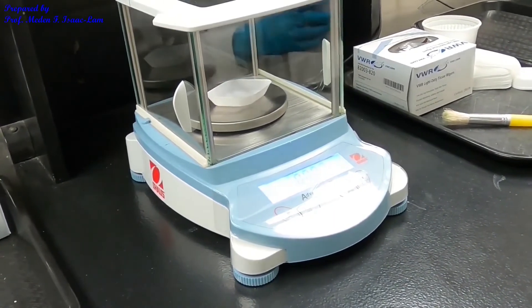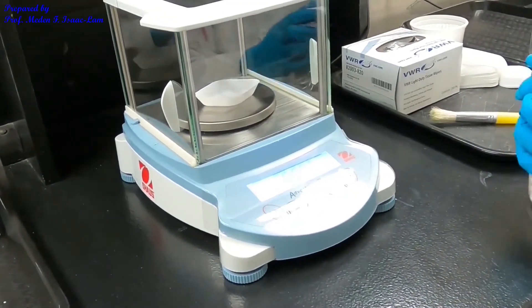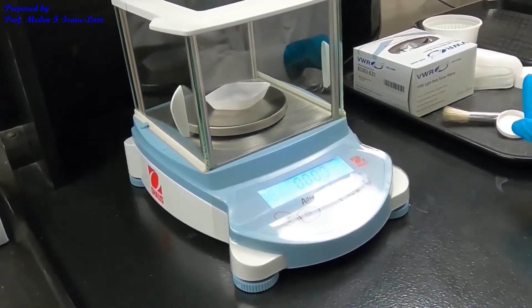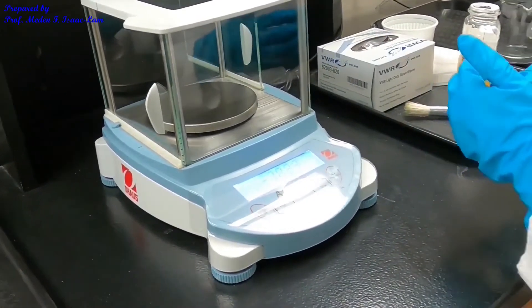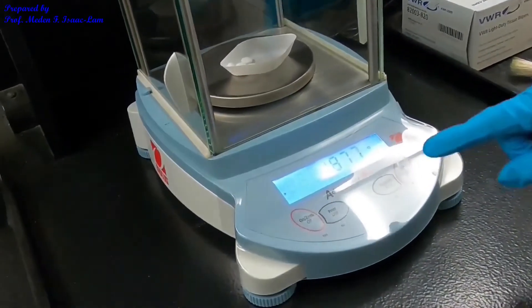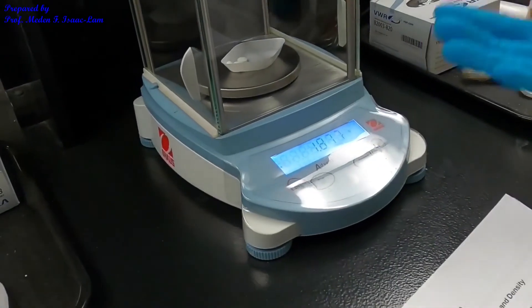I'm going to add 5 aspirin tablets. Each tablet is 325 mg of aspirin. After adding 5 tablets in the weighing boat and placing it inside, the weight of the 5 tablets is 1.877 grams. You are going to calculate the mass of 1 tablet to the correct number of significant figures by dividing this by 5.